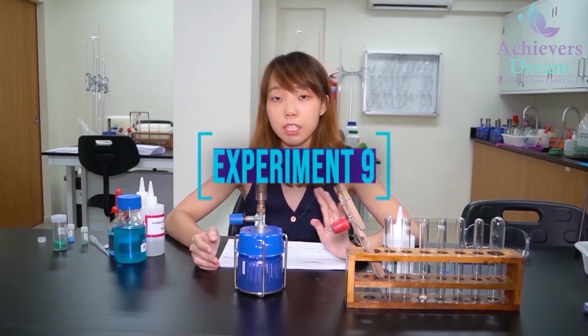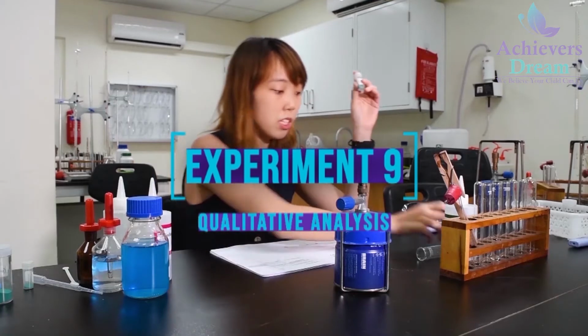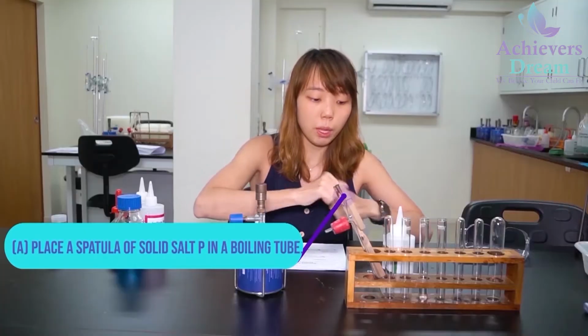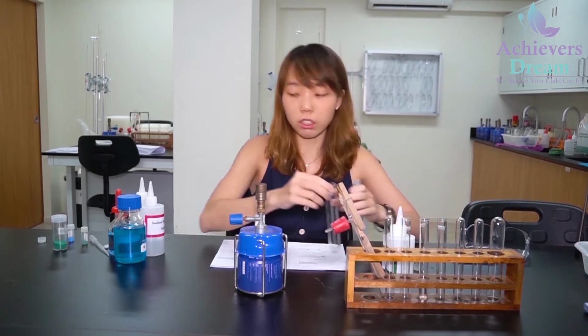Okay, so today we'll be doing experiment 9. You're provided with two solid samples here, salt P and salt Q. For the first step, I'm going to place a spatula full of solid salt P in a test tube, but I'm using a boiling tube because we'll be doing strong heating later.